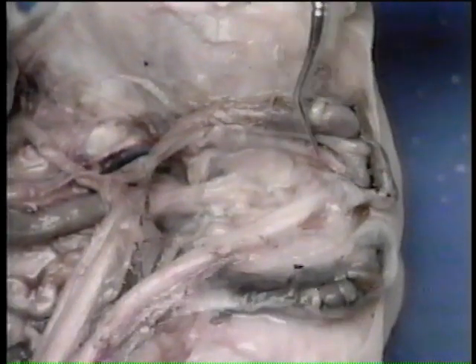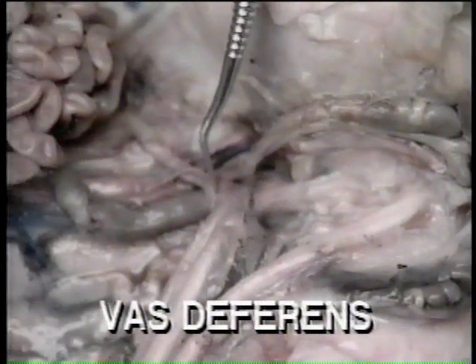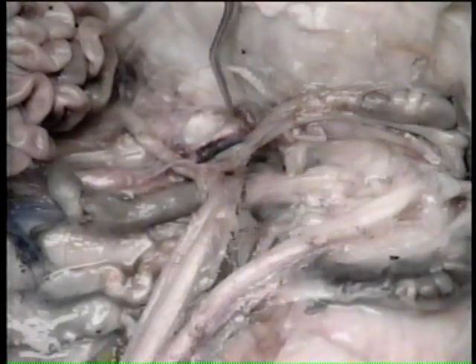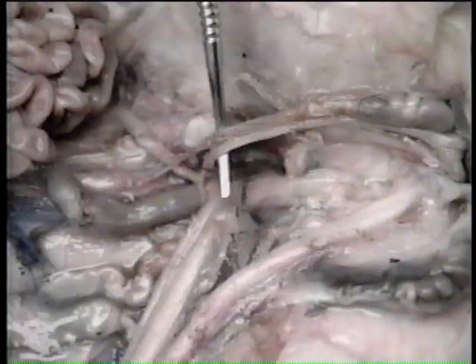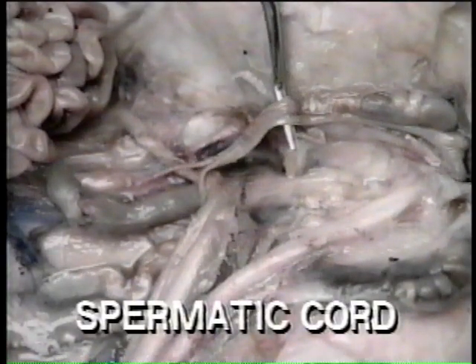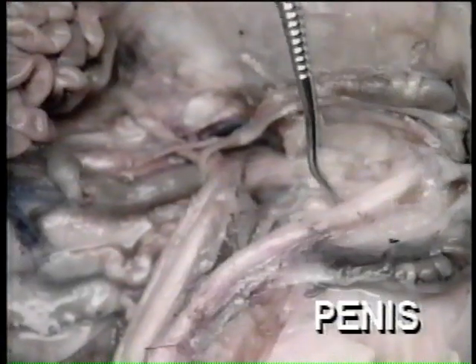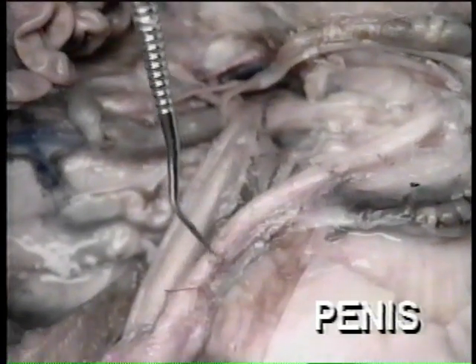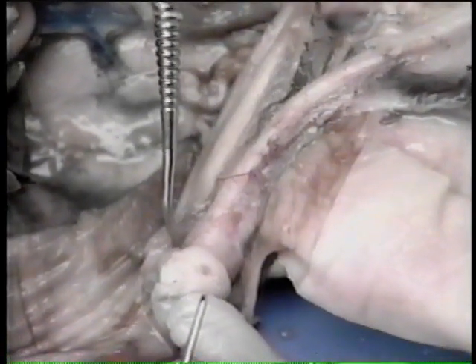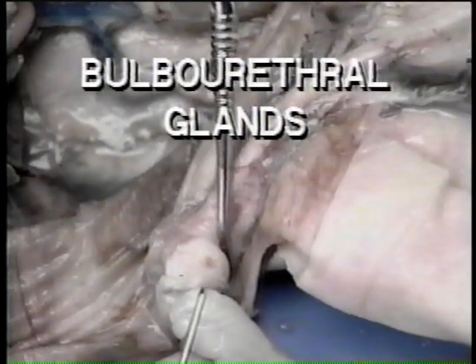The vas deferens proceeds from the tail of the epididymis and empties into the urethra. Together, the vas deferens, the spermatic artery and vein, and the spermatic nerve form the spermatic cord. The penis is the white tubular structure previously observed. The two large elongated glands lying between the urethra and the penis are the bulbourethral glands.